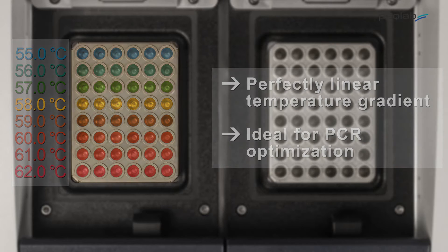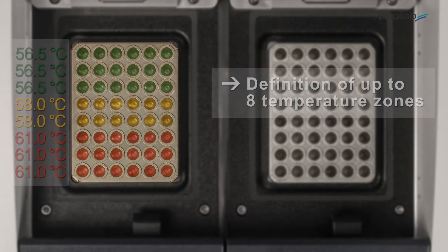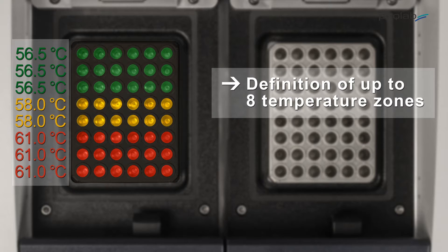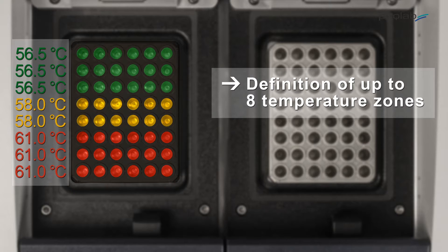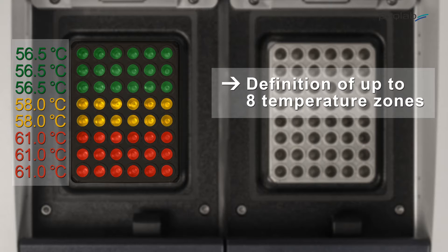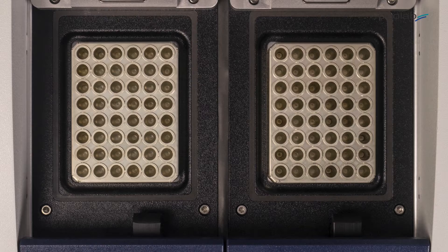Most notably, flex gradient technology enables the programming of up to eight individual and discrete temperature zones. This can be used for running PCR reactions with different annealing temperatures simultaneously in the same block.